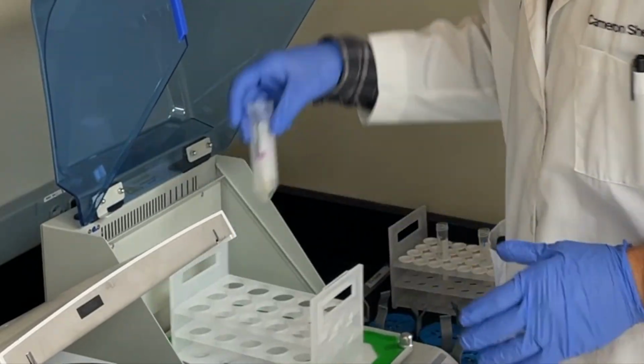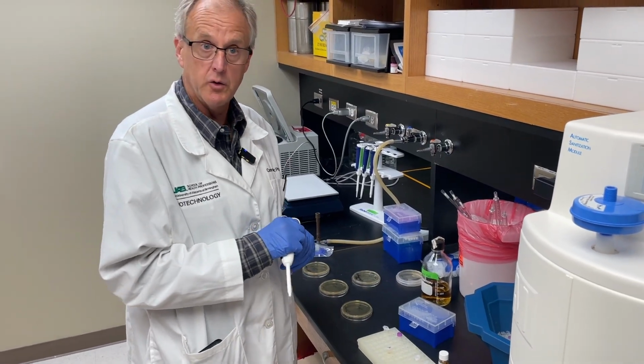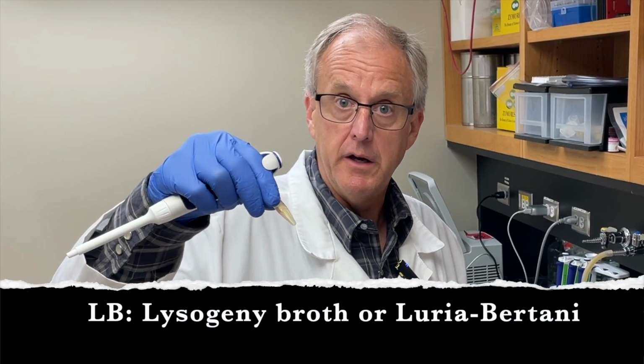Time's up. Okay. I'm going to do a 1 to 10 dilution of this transformation mix, and I'm going to put it into LB media.